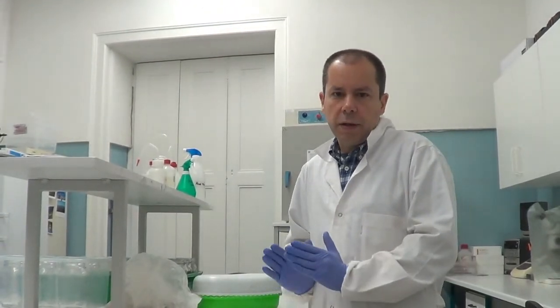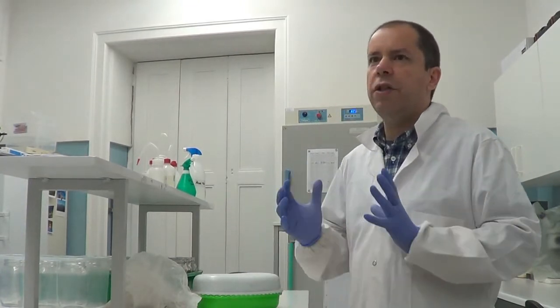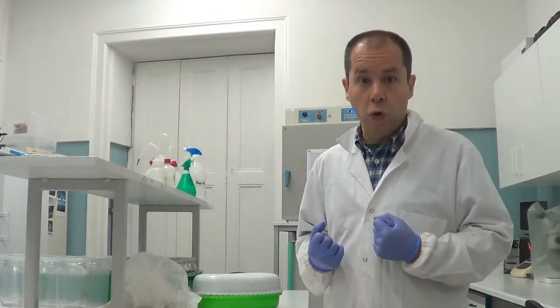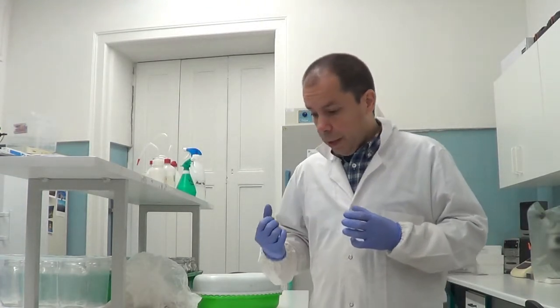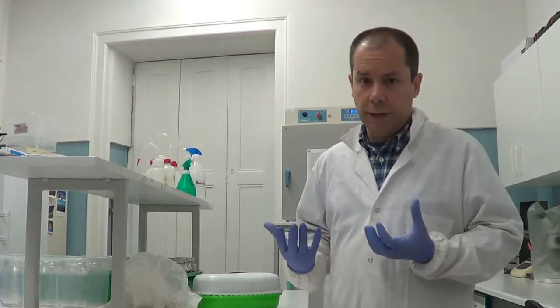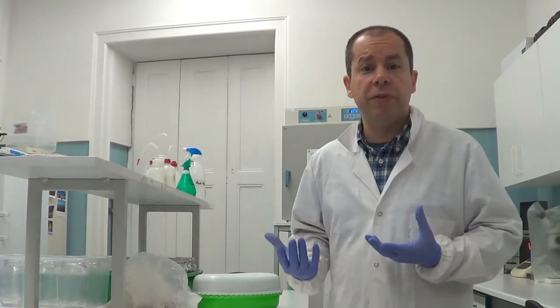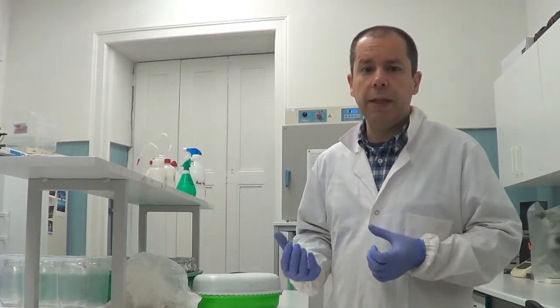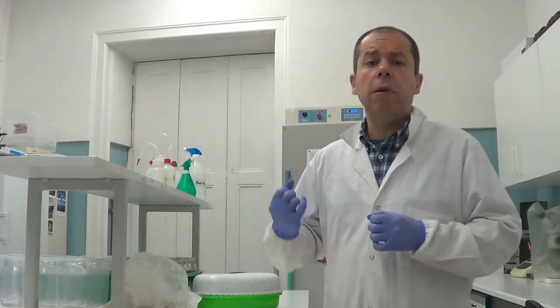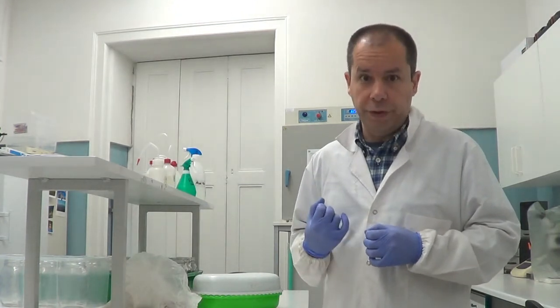What does this concept mean? The water holding capacity is the maximum amount of water that one soil is able to hold. This value is usually expressed as a percentage. For instance, if we have a soil with 30% of water holding capacity, this means that 100 grams of soil is able to hold a maximum of 30 milliliters of water.